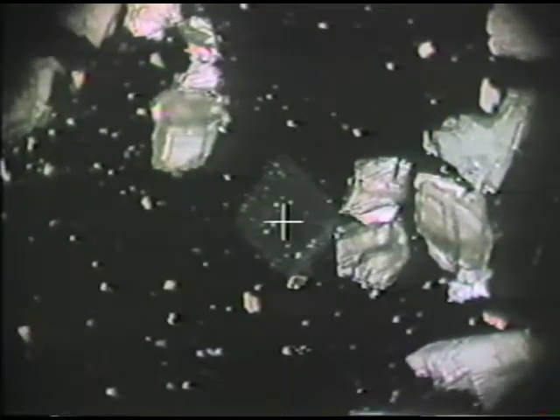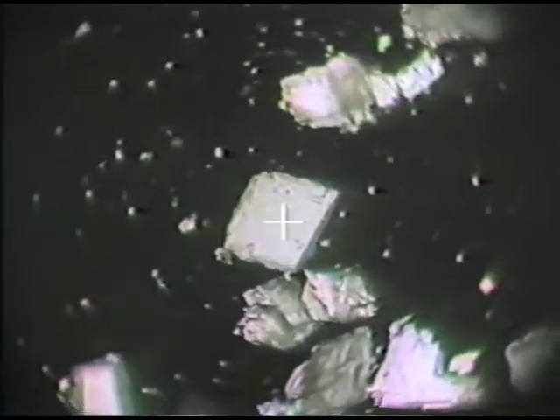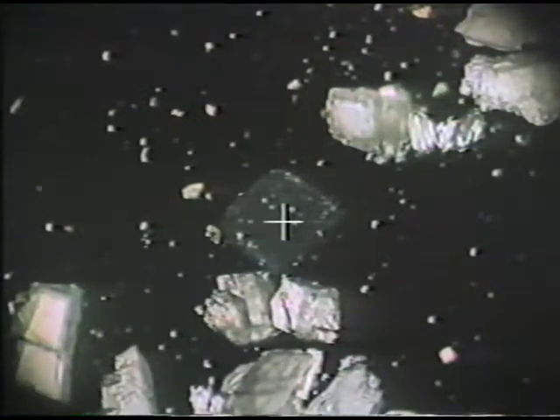Here are the calcite grains now. We're looking at them again in cross-polarized light, and I'll put the crosshair reference position on the screen again. I want you to notice that the calcite rhombs are at extinction at a time when the rhombohedral angles on the edges of these forms are exactly bisected by the crosshair.